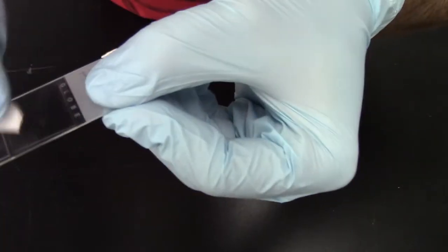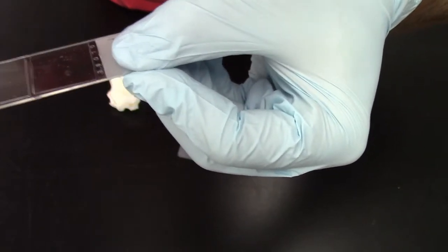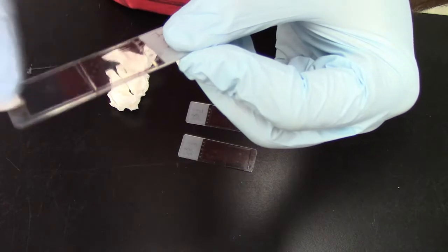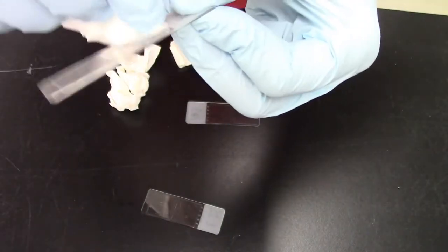So you can see right now, if I do a little bit of this, a bit more of this, it will be nice and clean. And keep in mind the goal is to not move the coverslip. If you move the coverslip, this slide is done. So try to be as careful as possible with that.